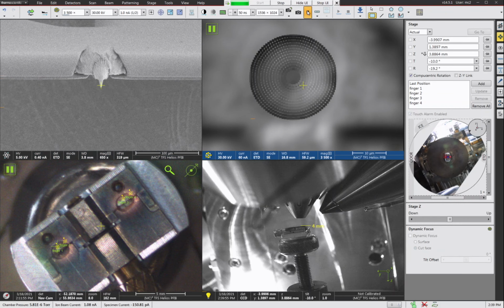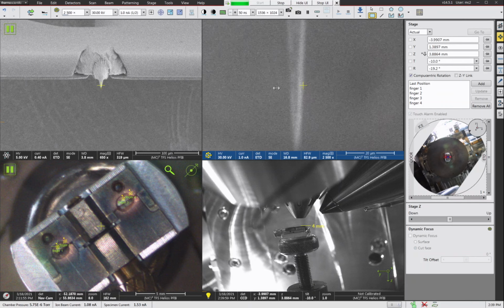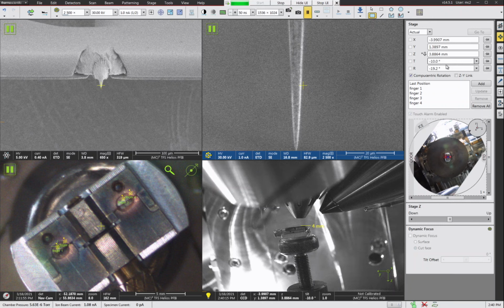Okay, so now we have our FIB image, and we could go ahead and focus, and then we would use a pattern to chop this off at whatever value that we wanted to. Now on our Helios PFIB, we can actually go to a more negative tilt than this. We can go all the way to minus 38 degrees.